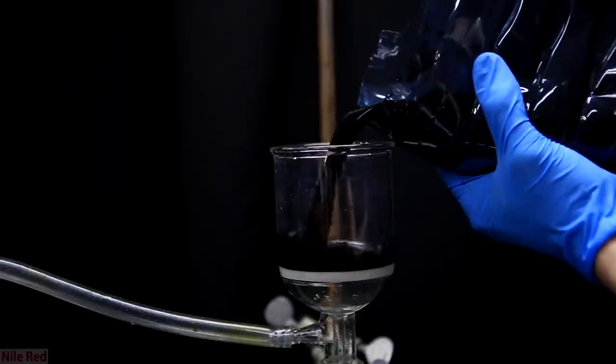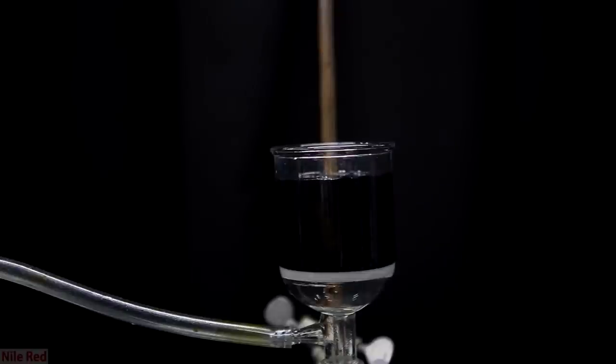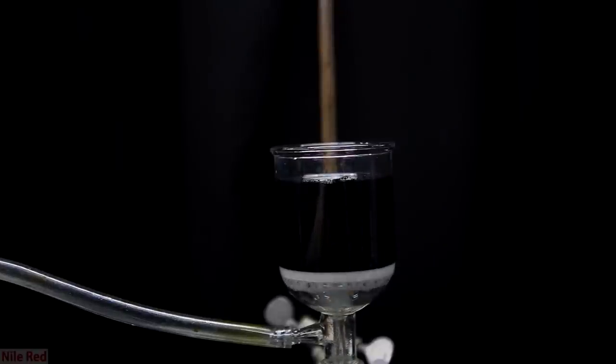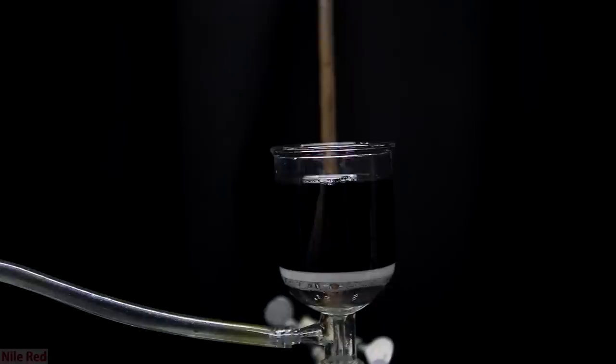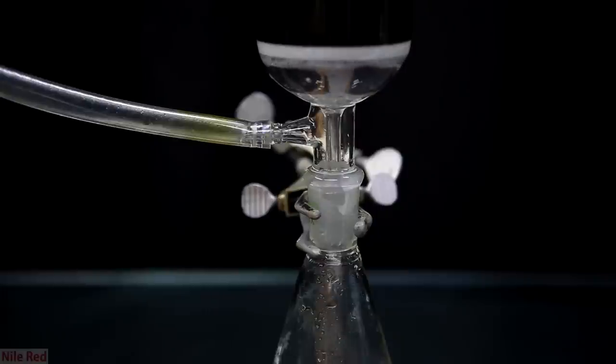For this step I opted to vacuum filter off the remains at the bottom. I only did this because the volume I had to take off was very small. If I vacuum filter it immediately without allowing the manganese dioxide to separate it from the water, the filtering step would have taken a very long time.